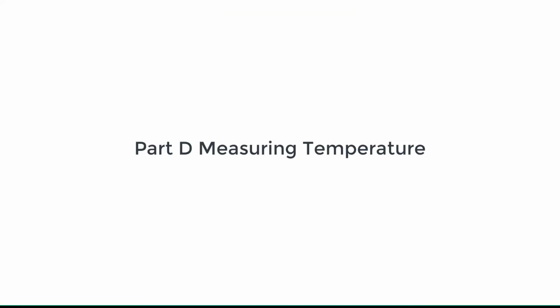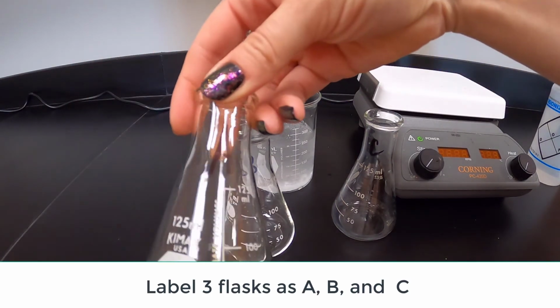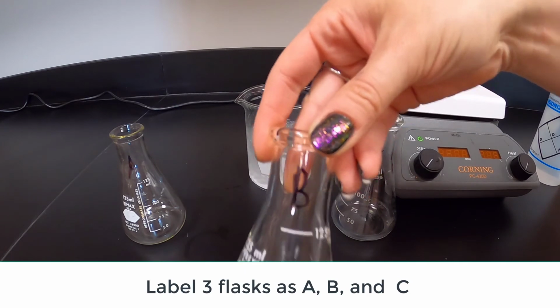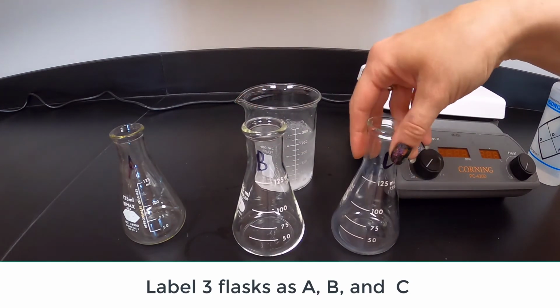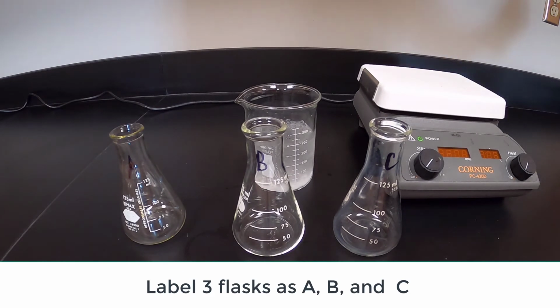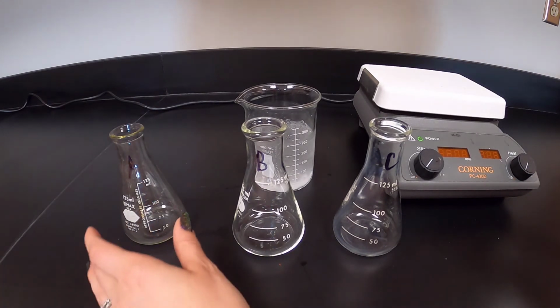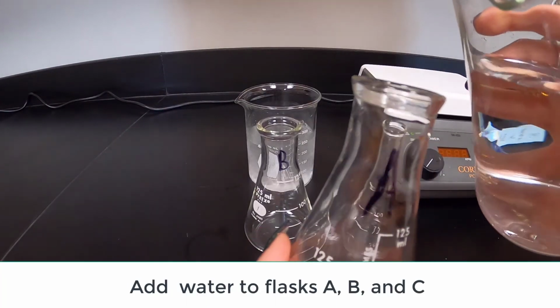Part D. Measuring temperature. Label 3 125 ml Erlenmeyer flasks. Label these as A, B, and C. Add water to each flask until they are approximately 2/3 full.